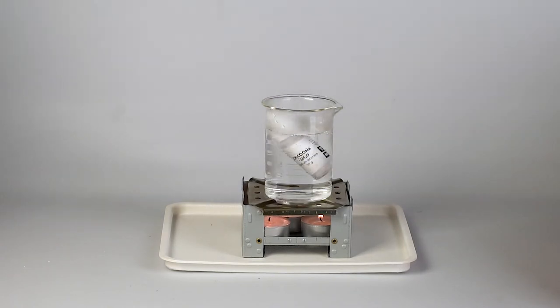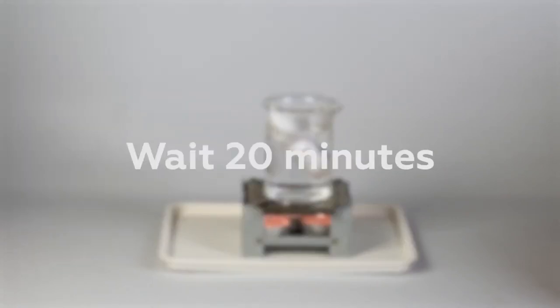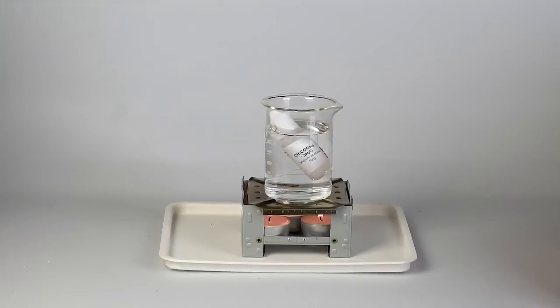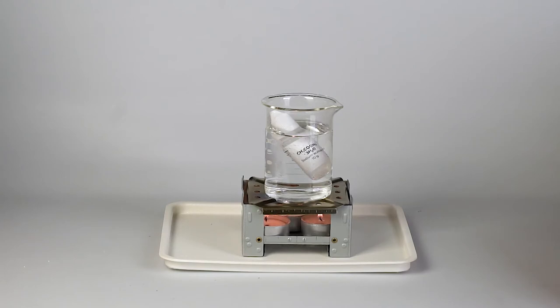Carefully put the bottle with sodium acetate into boiling water and wait 20 minutes. During this time, all the sodium acetate should dissolve and form a solution. In a crystal, sodium acetate is bound with three molecules of water. When the crystals are heated, they release the water, which in turn dissolves the solid acetate.